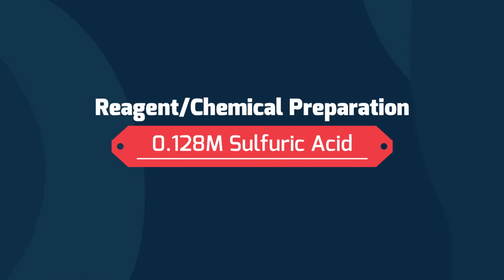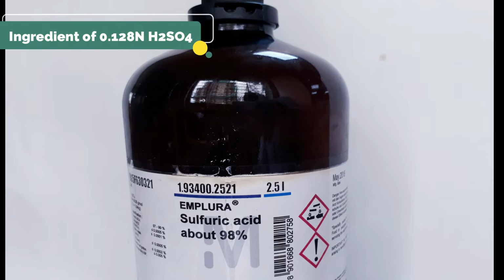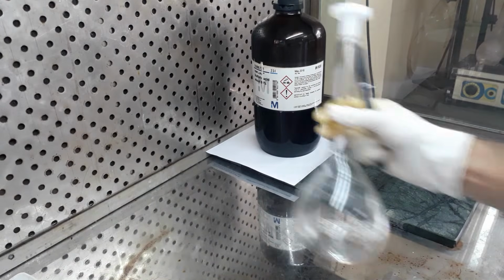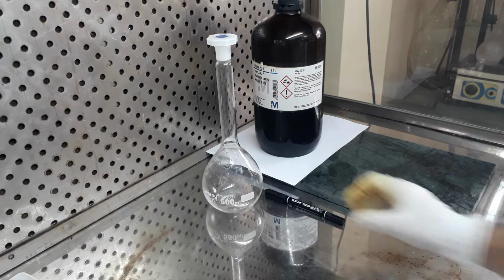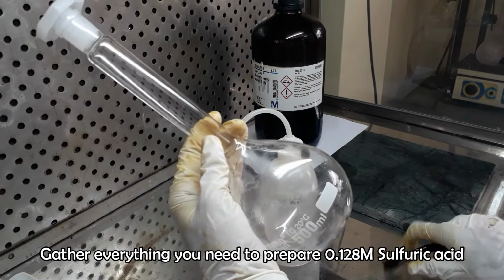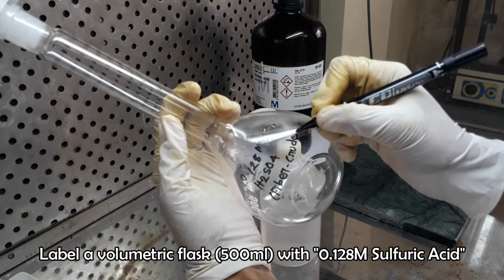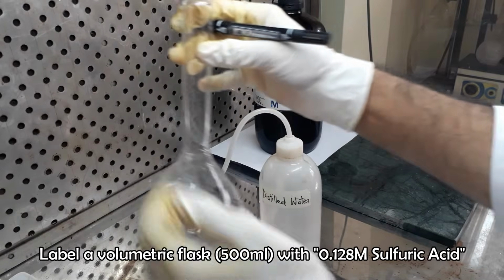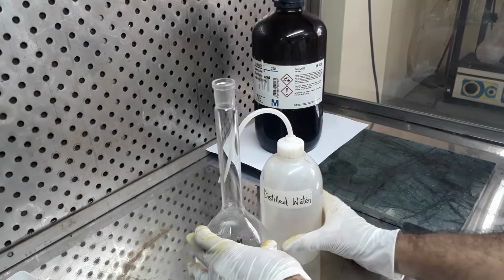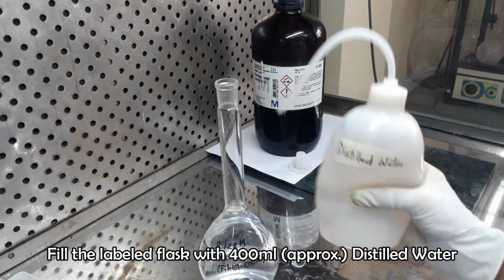To prepare 0.128 molar sulfuric acid solution, we need concentrated sulfuric acid. Firstly, take approximately 400 milliliters of distilled water into a volumetric flask.